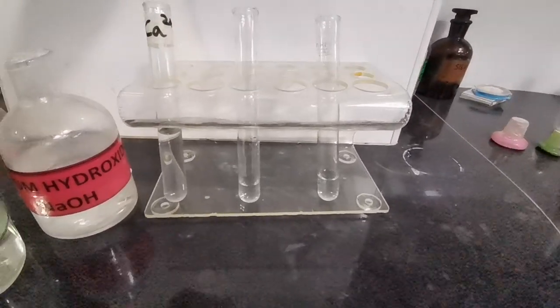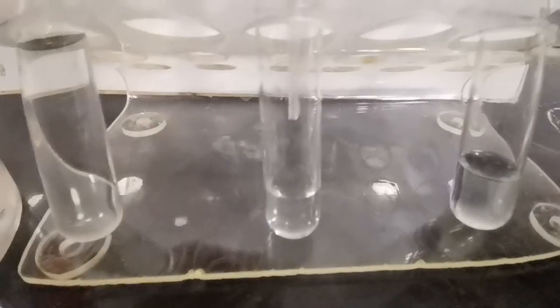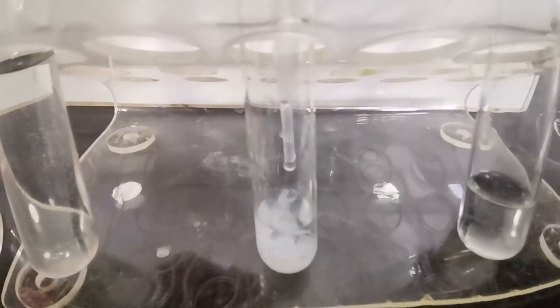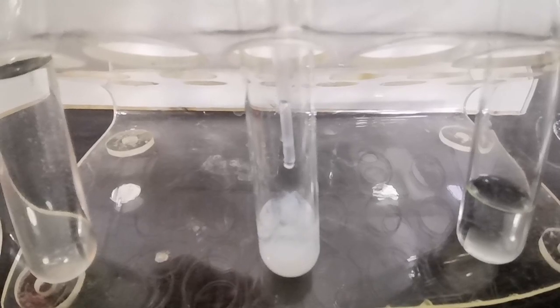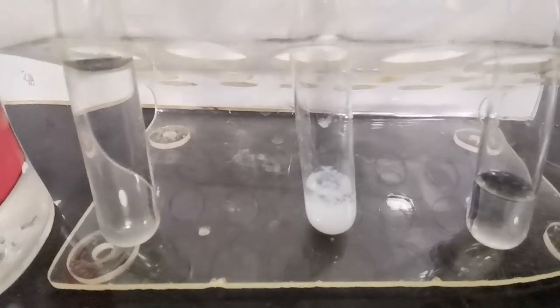We add a few drops of sodium hydroxide to the clear solution of calcium ions and we see formation of a white precipitate.